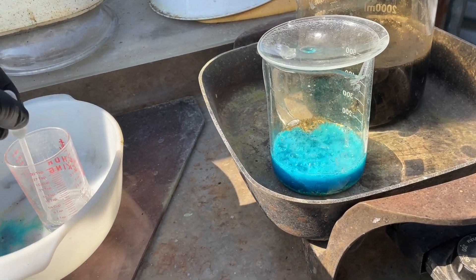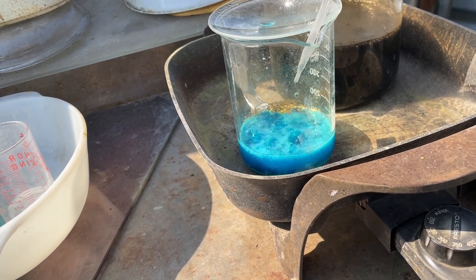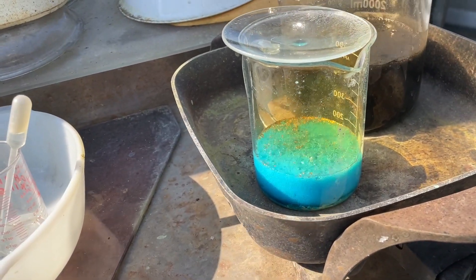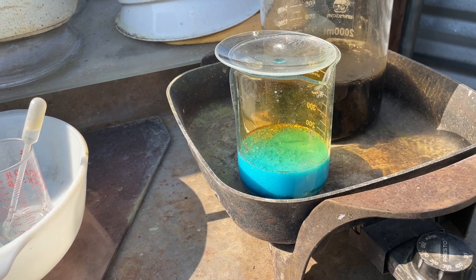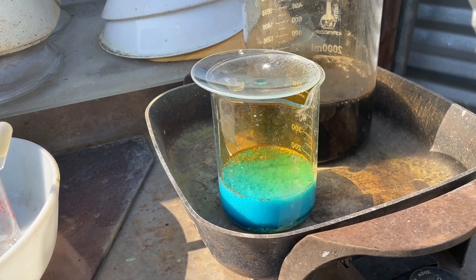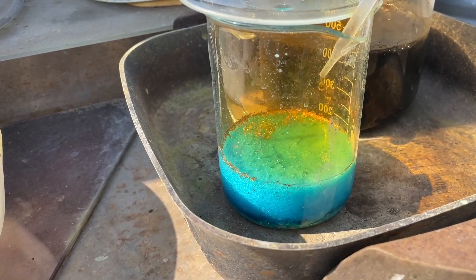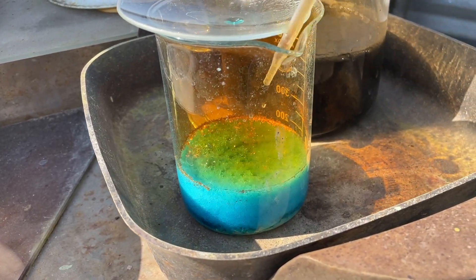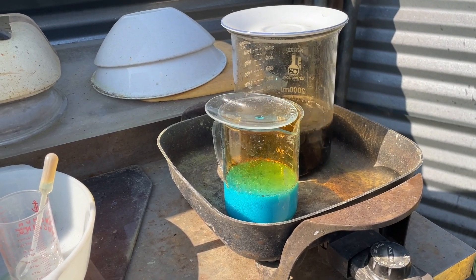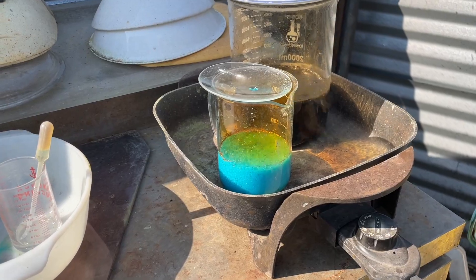The first bit of nitric is about burned off so I got a little bit of nitric acid in here. Try and dose this guy just a little bit. Okay, it's hot right. All right guys, there's three milliliters. Yeah look at it go though. I'm way up cooking now. Let's try one more shot nice and slow. Yeah let's put it in there, there it goes. That's why I gotta be careful — just a little bit. Better let it ride like that for a while. I'll keep dosing it until we get those pins pretty much gone.